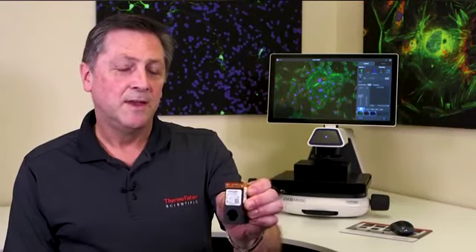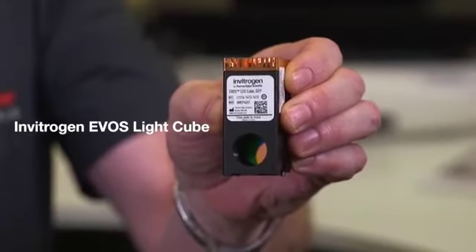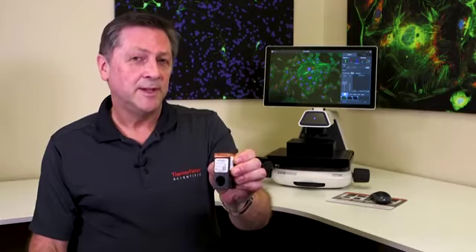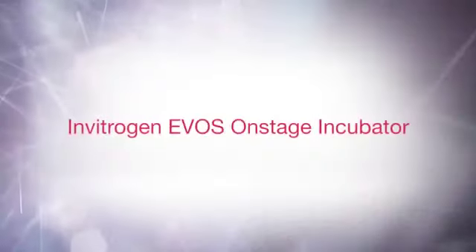The illumination system is still based on an LED light cube, which has the LED built inside with electronic controls. It can be turned on and off as many times as you like without shortening the lifespan, and the lifespan is over 50,000 hours. With 50,000 hours of use, you can actually turn it on for 8 hours a day, 7 days a week, and it will be over 17 years before you hit 50,000 hours.